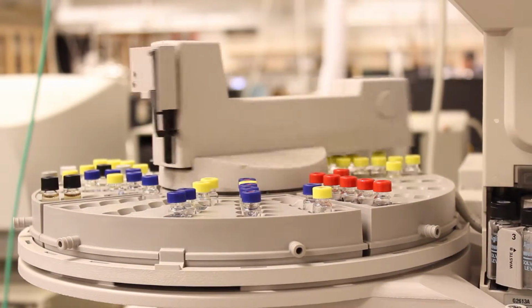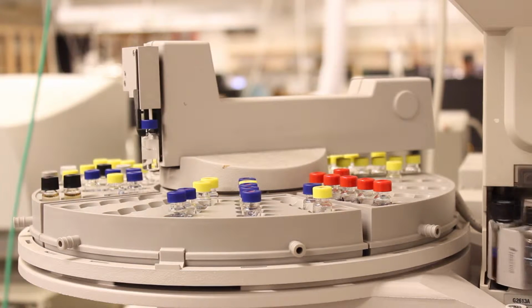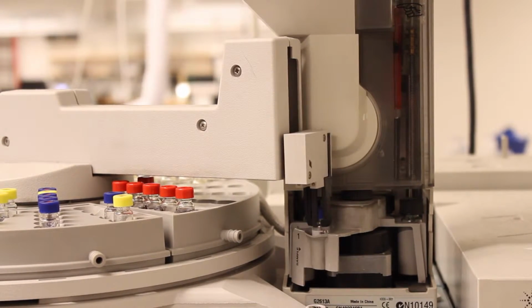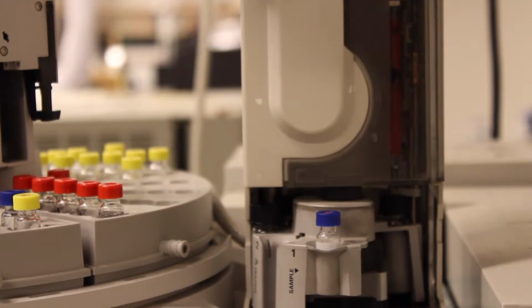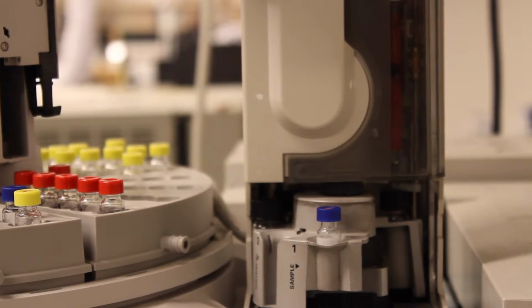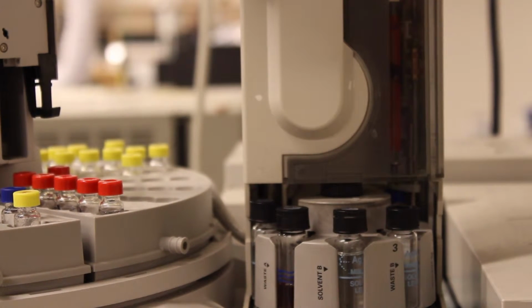The automatic sample changer will pick up your vial and load it into the instrument. It's normal for the sample changer to make a number of what appear to be unnecessary movements. Don't worry, this is normal behavior. The sample changer is going to wash the syringe several times before it loads your sample. To help prevent any sort of clogging of the syringe, be sure that the sample wash vial has an appropriate level of wash solvent already in it.